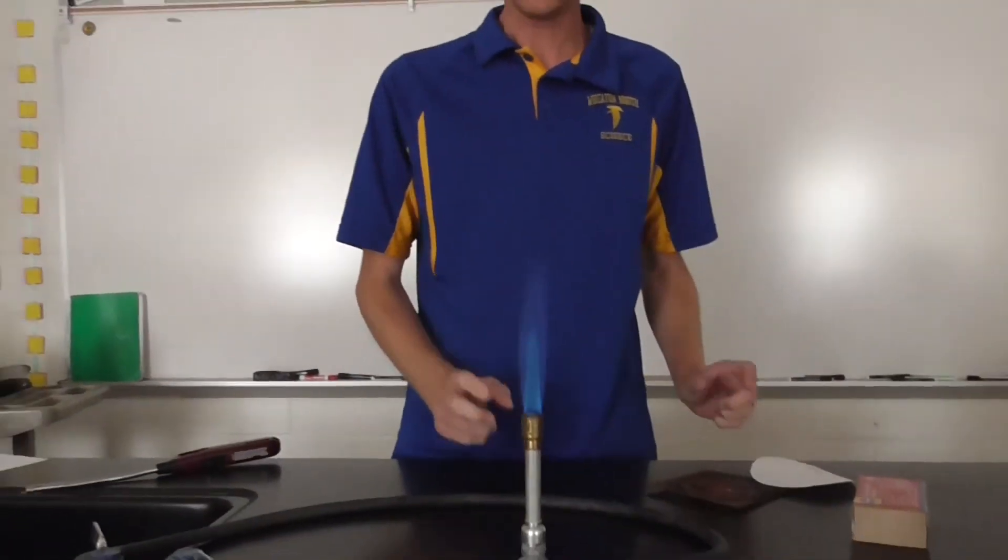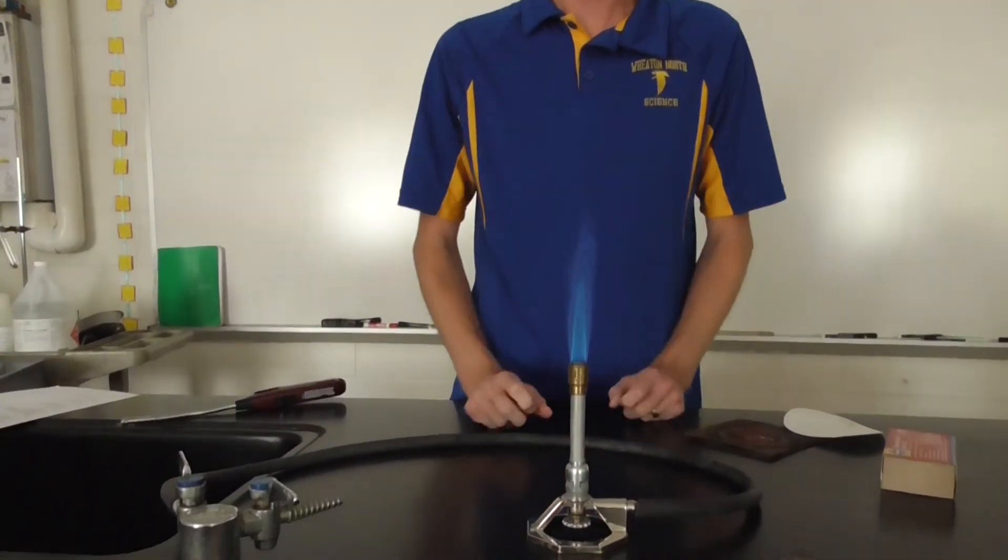So light the match first. Adjust both the screw and the barrel to achieve a flame that has an inner cone and an outer cone.